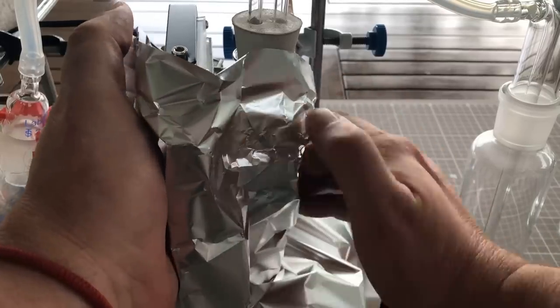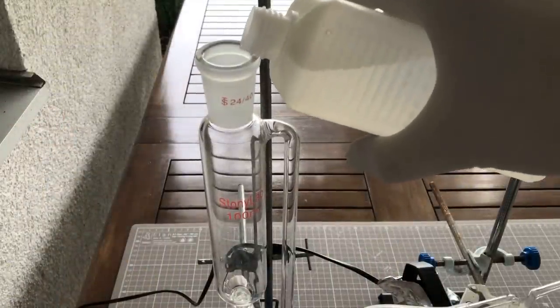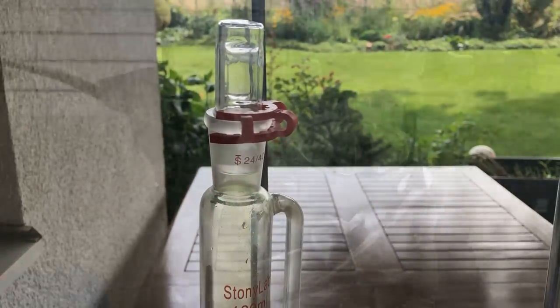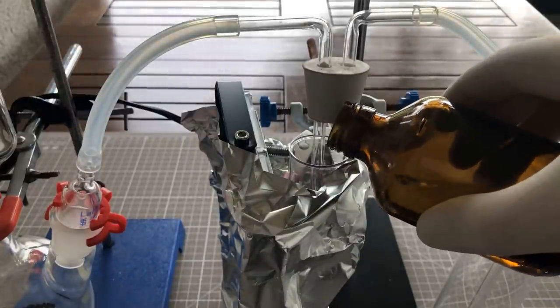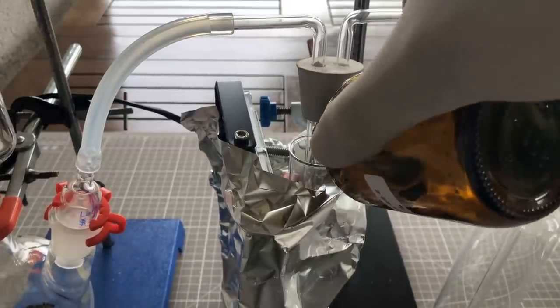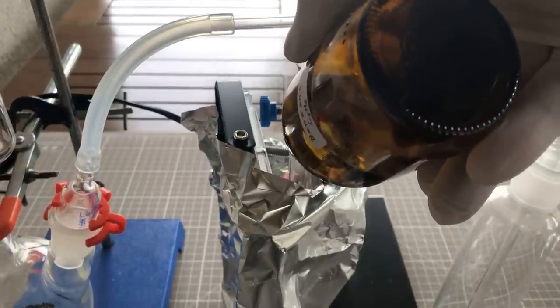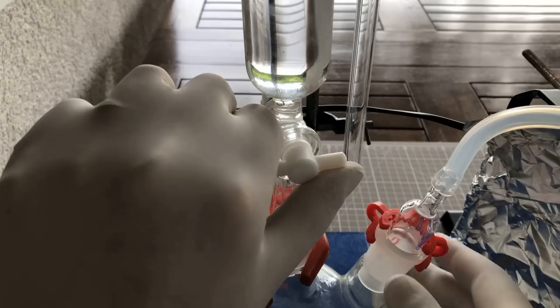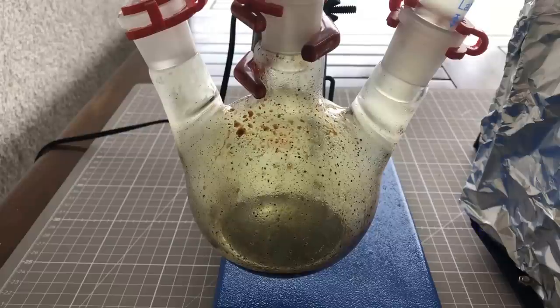As you can already see, some aluminum foil was wrapped around the test tube and the LED lamp acts as a reflector. 60 ml of 37% hydrochloric acid was then added to the addition funnel. The 28 ml of benzene I synthesized in the first part was subsequently added to the test tube. The stopcock of the addition funnel was opened enough to add the hydrochloric acid dropwise to the potassium permanganate.